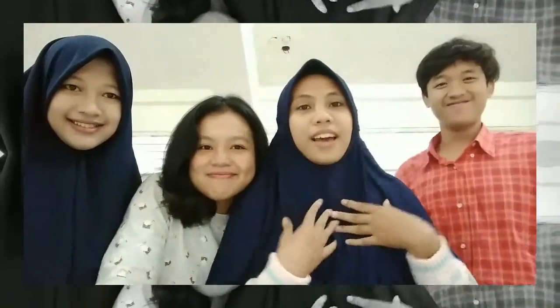Here I want to tell you about Liquicolor. Hello, let me introduce my team. This is Devan, Andhika. My name is Tiara, and this is Ribka. This is Adelia. So here I want to explain to you one photometric colorimetric test for chloride, the TPTZ method.